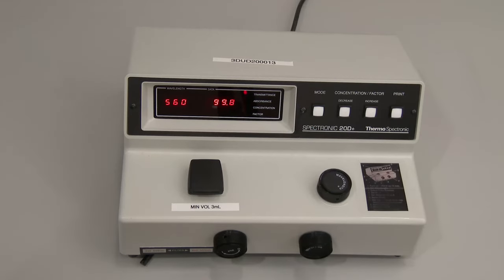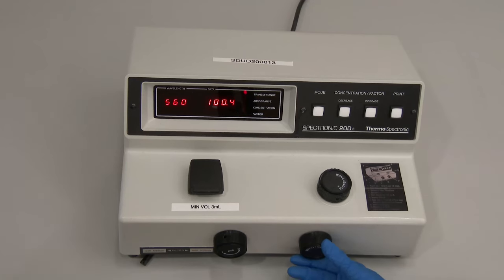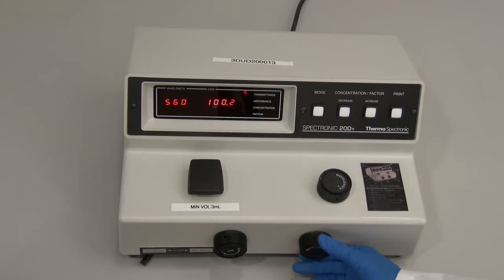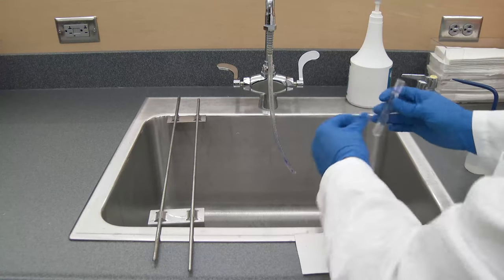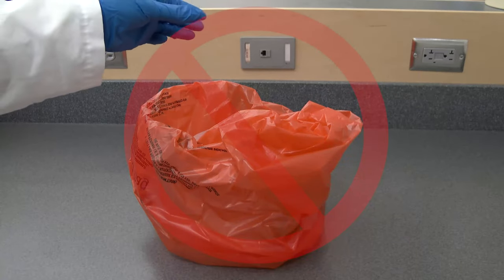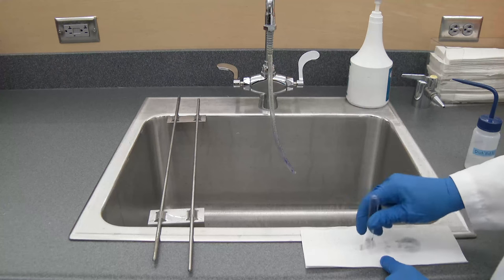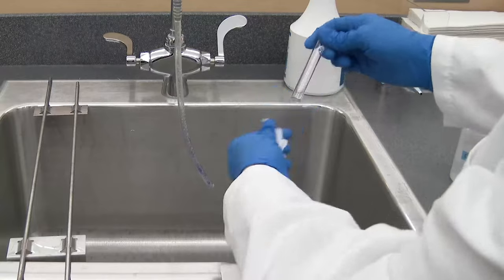Using the transmittance absorbance control knob (100% T / 0.0 A), adjust the display to 100% transmittance or zero absorbance, depending on the mode previously selected. Remove the cuvette and appropriately discard the water or reagent. Do not discard the cuvette, as it will be reused. Rinse the cuvette three times with distilled water and gently tap the rinsed cuvette on a small stack of paper towels to remove the remaining water. Use a lint-free tissue to wipe the outside of the cuvette.